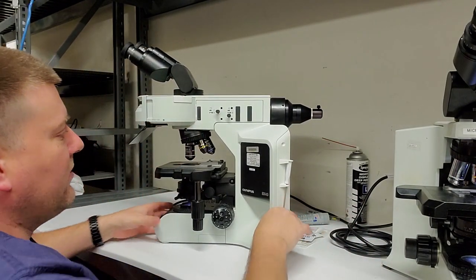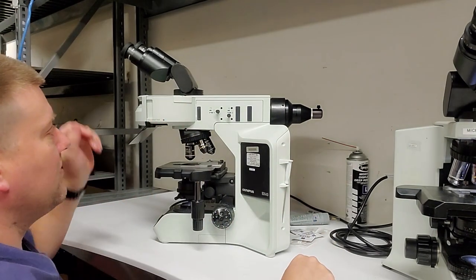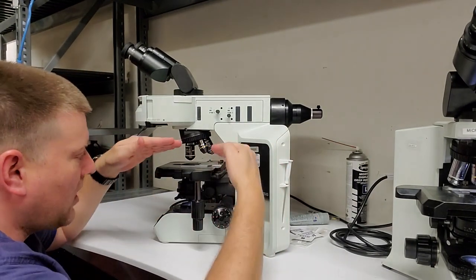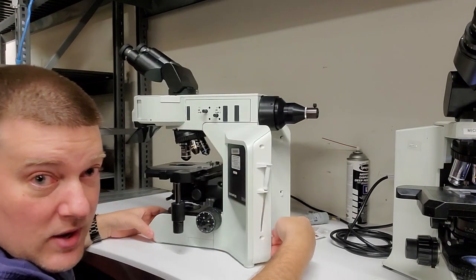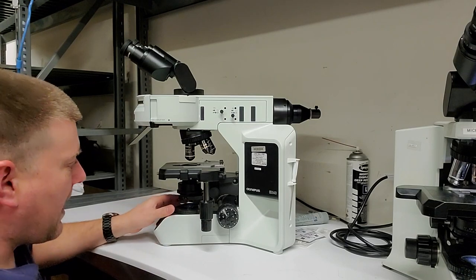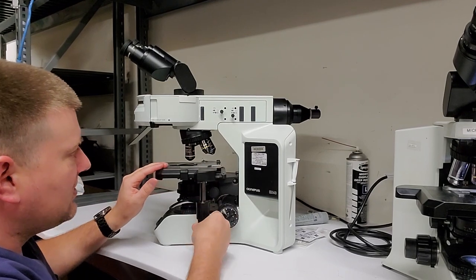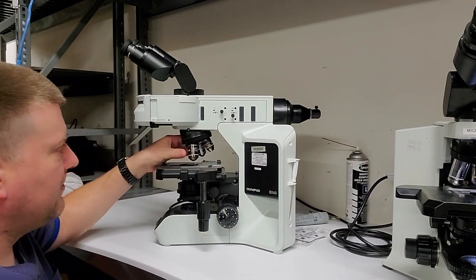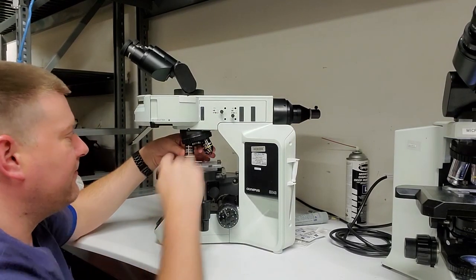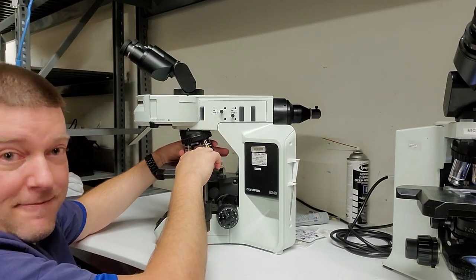Let's take a look over here at the BX43 with a fluorescent headstock, okay? So it's almost the exact same microscope. We have the same chassis, except we have an LED bulb. I have my dimmer on the front of this guy. We have the aperture, we have the condenser, all the same, right? The stage, just the same. We have a turret with different objectives. But mind you, remember I said fluorescence microscopes have fluorescence objectives. And right here, it's got an inscription on them that it's got FL, to let you know.